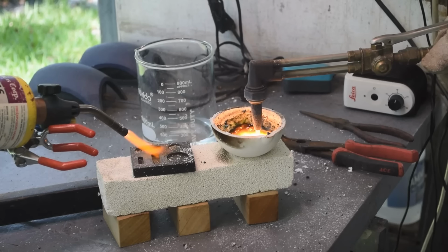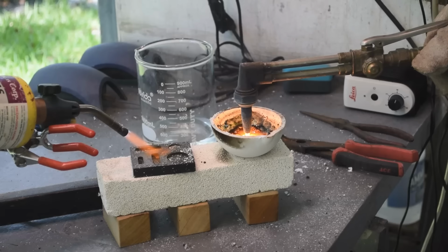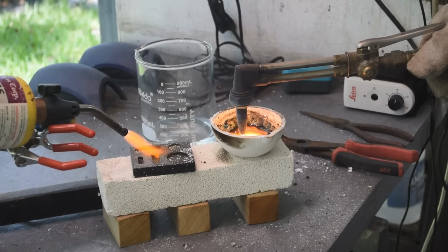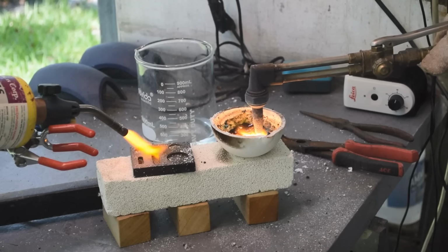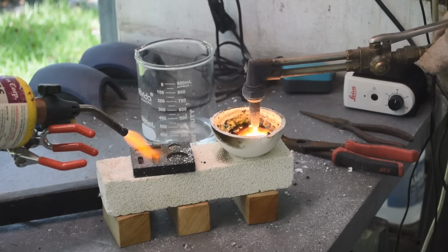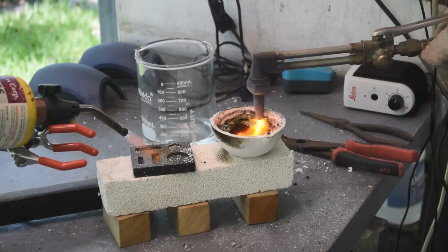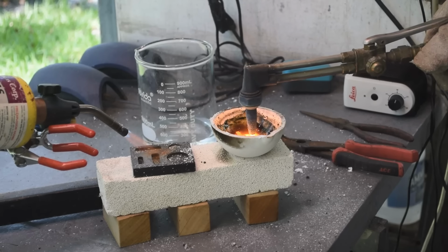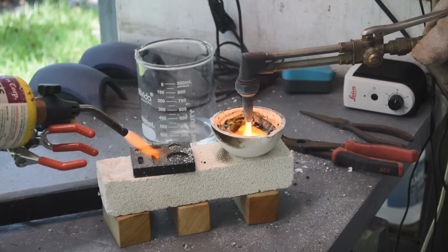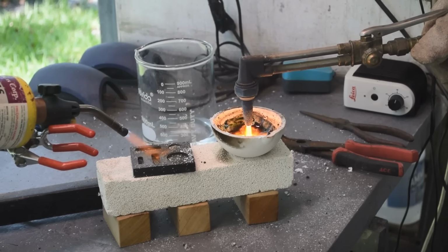I can melt the metal in one spot, but as soon as it melts, it kind of flows away from the flame and then hardens immediately. If I move the flame a little bit, it just rehardens immediately. So, yeah, my torch simply is not hot enough to melt this palladium into a single bead. I'm going to keep trying for a while, and I won't make you watch it all because it's painful. But yeah, it's just not working.